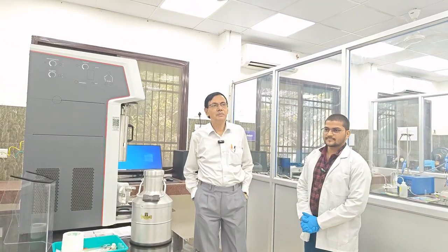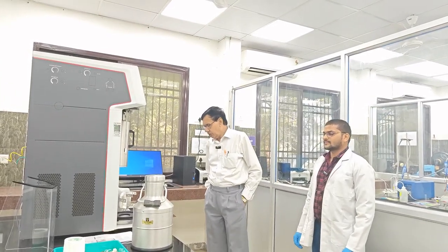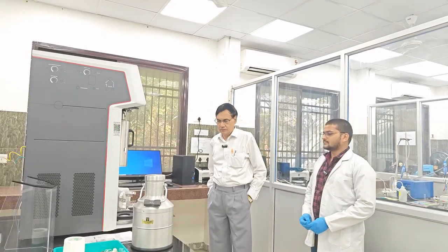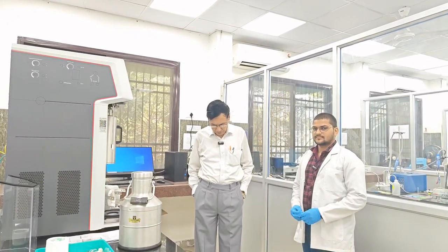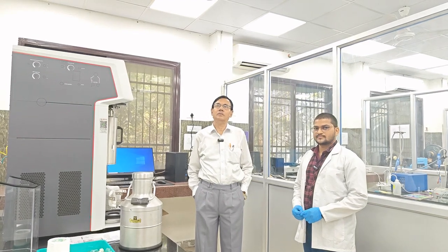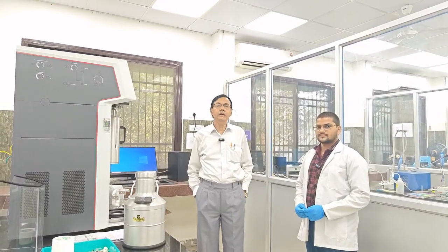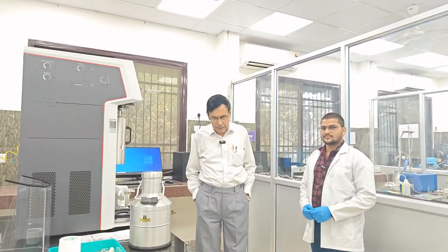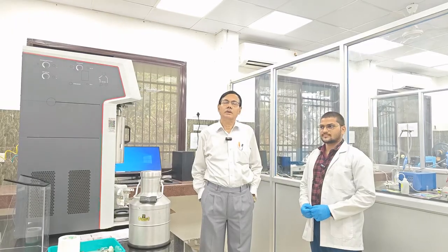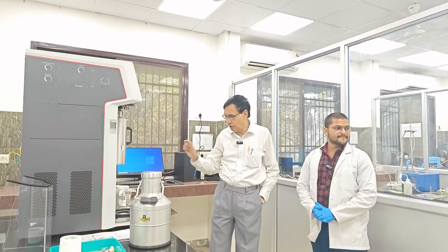Good afternoon, students. Today we will demonstrate a very important experiment, that is the determination of the BET adsorption isotherm and determination of the specific surface area of a sample.